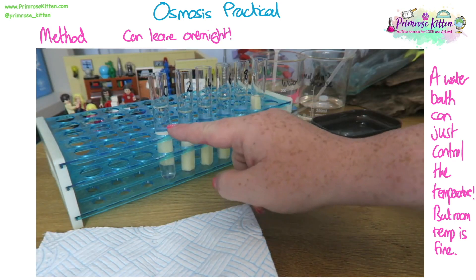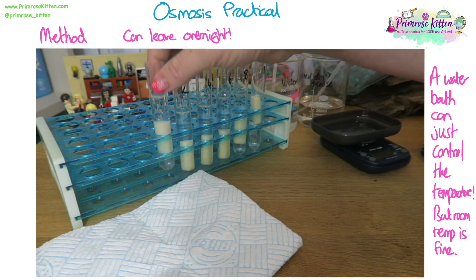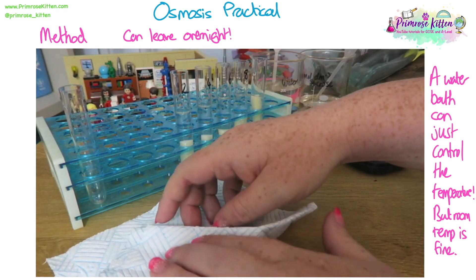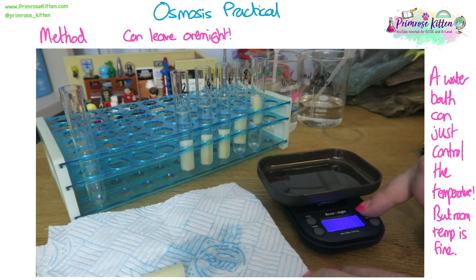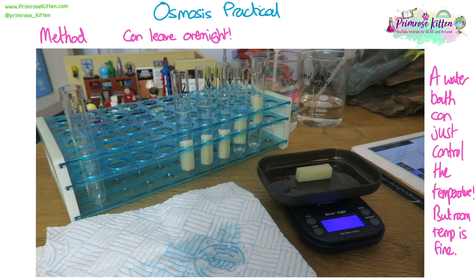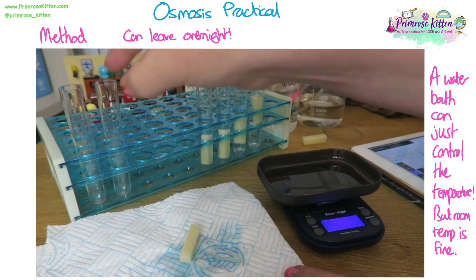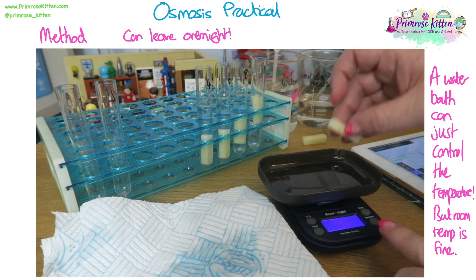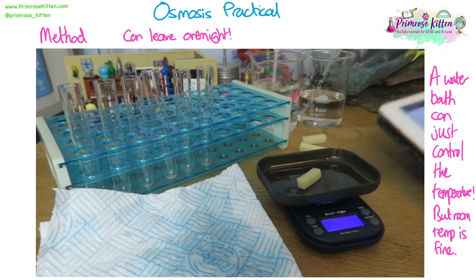Once these have been incubated, we can take them out, dry the potato chip again, weigh it again, and put the results in our results table. I'm just going to tip the solution out as waste, get the chip out, and dab it to dry — we're not squeezing it. Pop it on the scales, make sure they say zero, and write down our results: 2.77. Then get the next one — again, dab it to take off any excess so you're not adding extra weight. Check the balance is at zero and write it on. Now we've got our results and can do calculations.